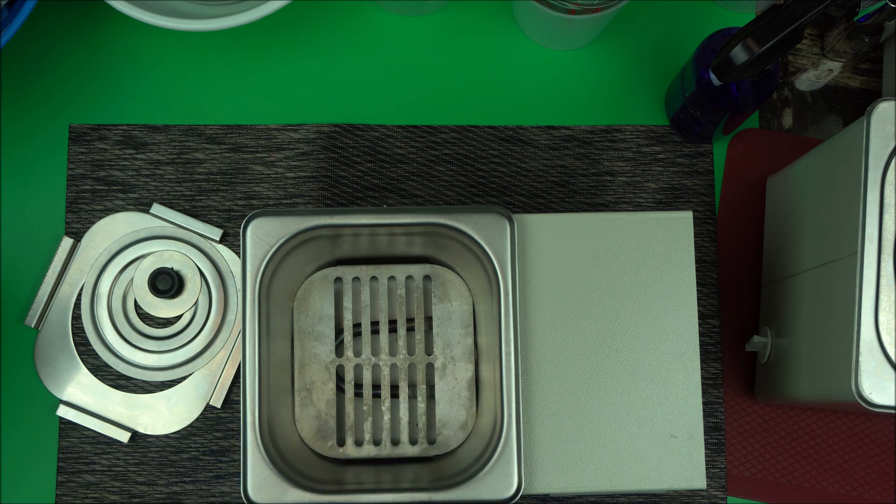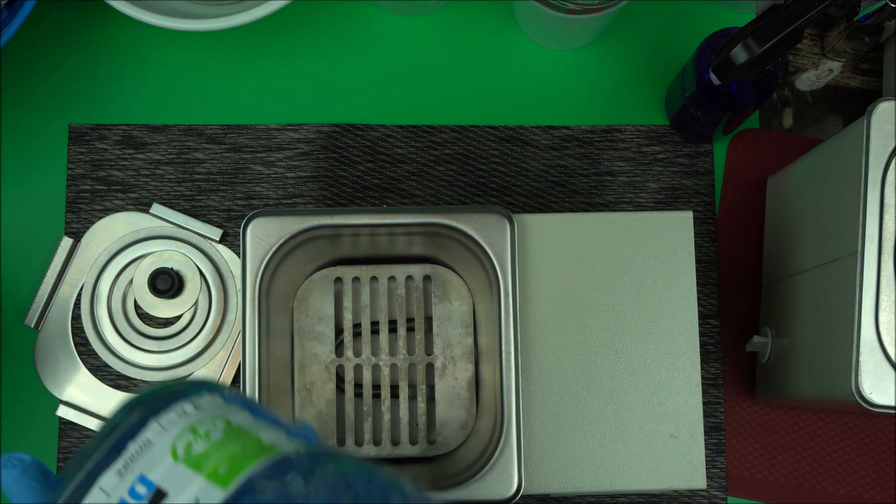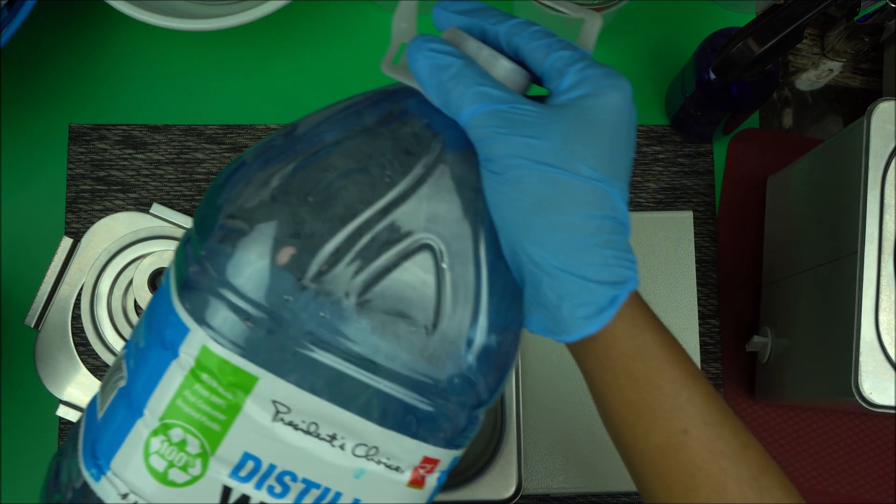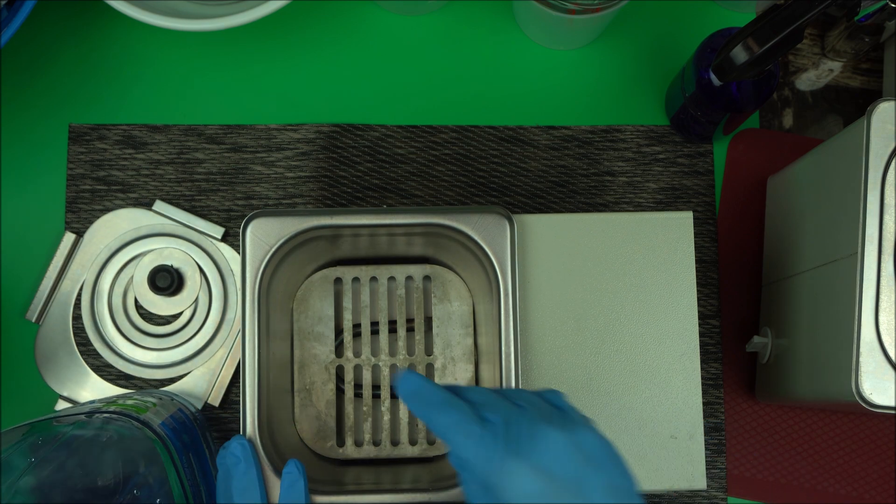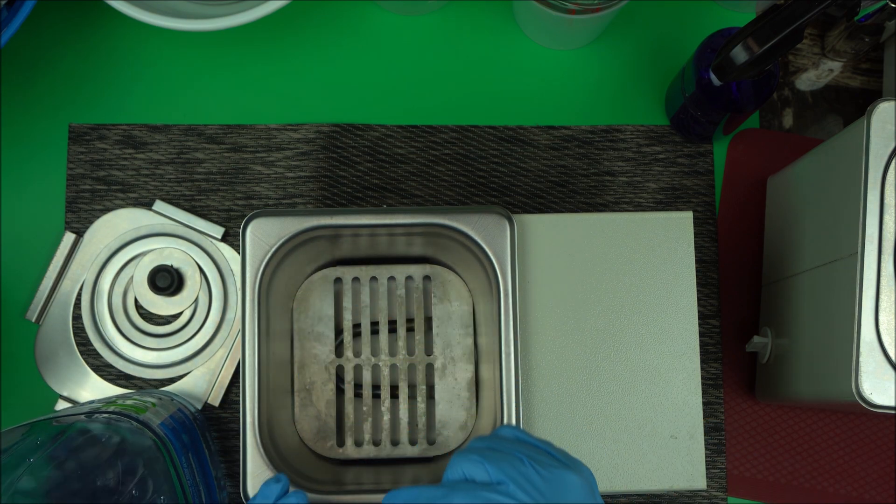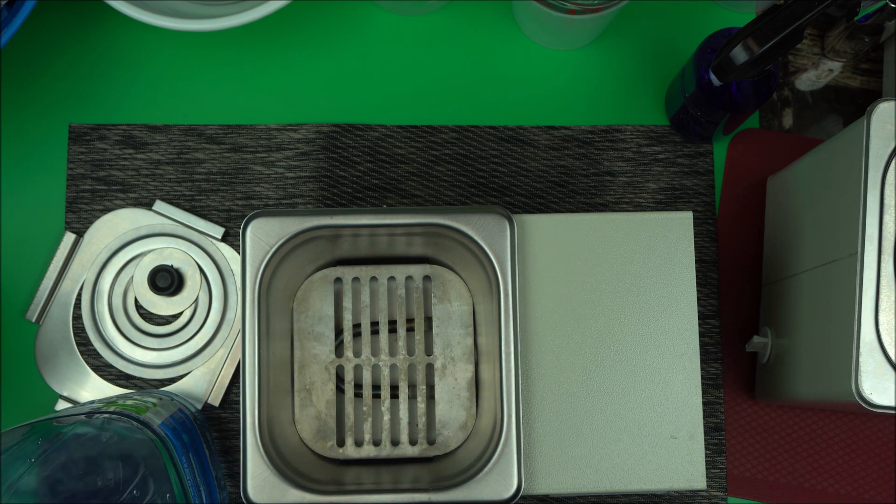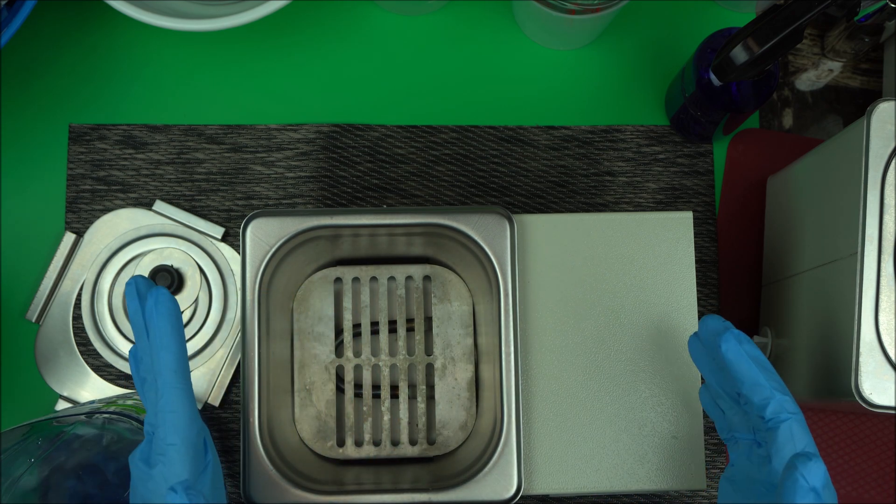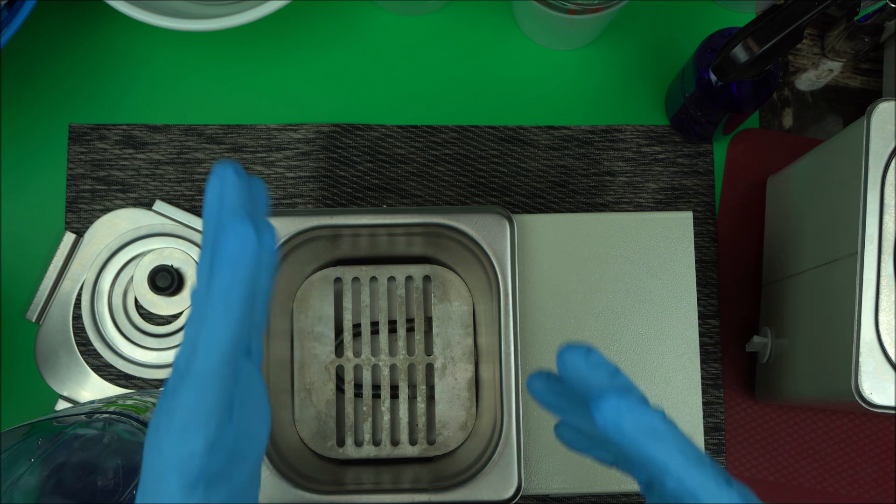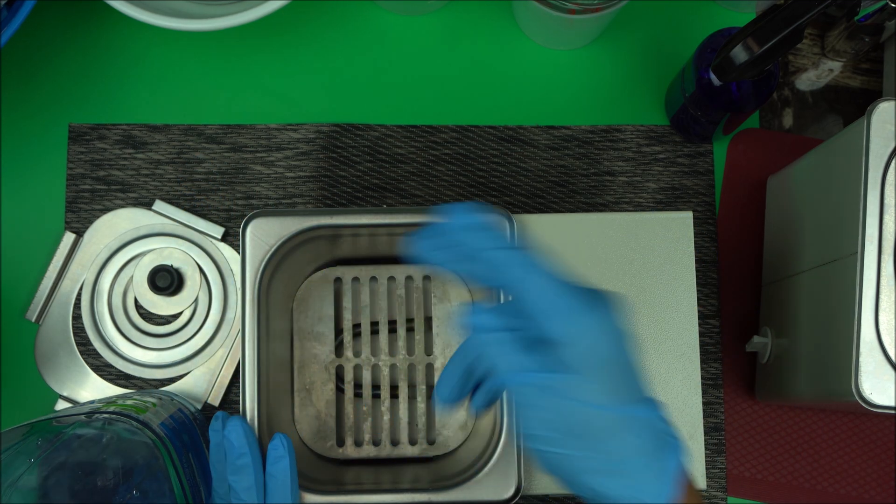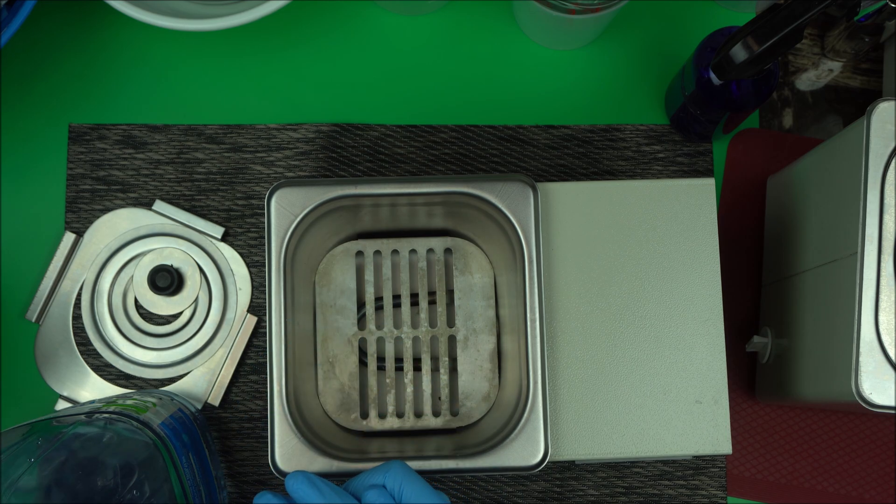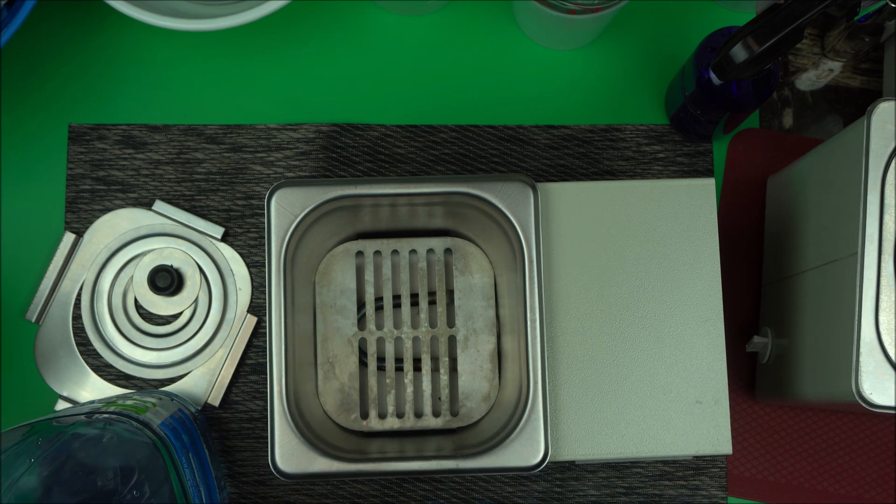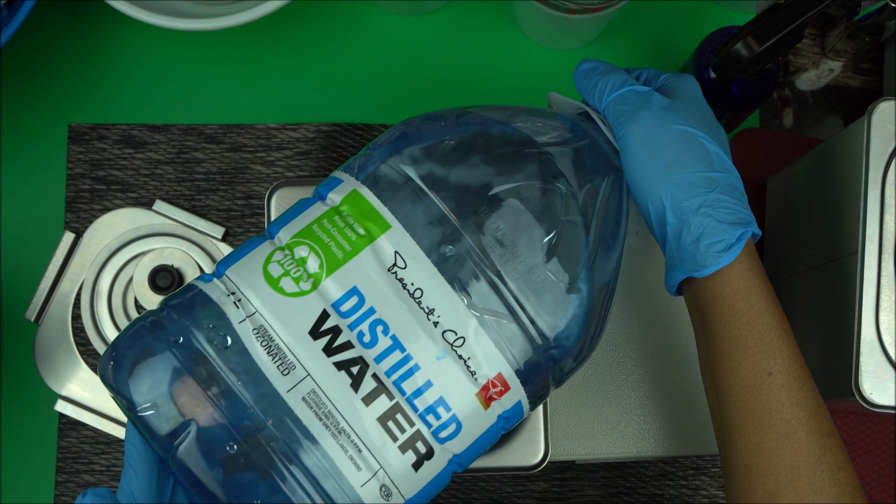Use distilled water. You can use regular tap water but the problem is you're going to have a lot of sediments. Distilled water is purified water so a lot of impurities that form yucky mess have been removed. Make sure you use distilled water.